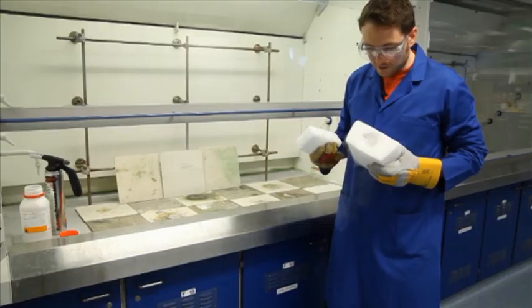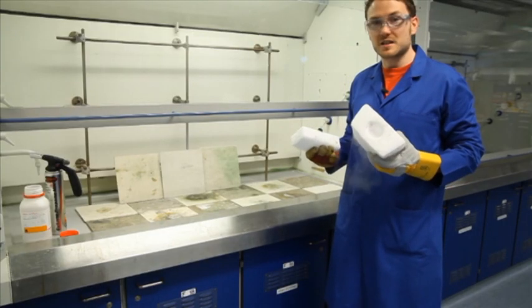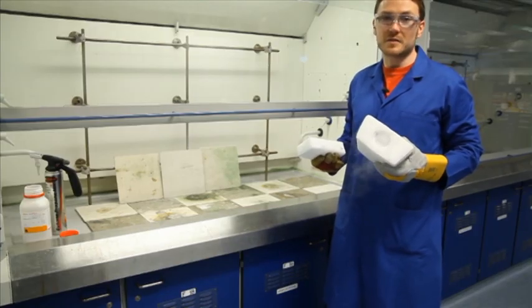Eventually you'll end up with something that looks a little bit like this. You can use these blocks more than once, so potentially you could team up with other teachers in the department and run a series of these experiments on the same day.